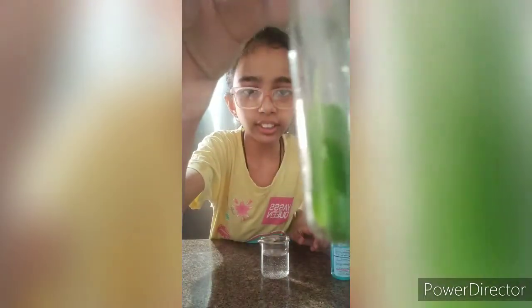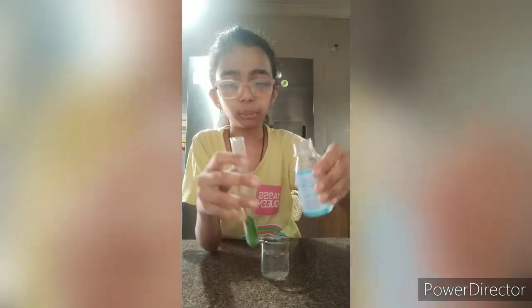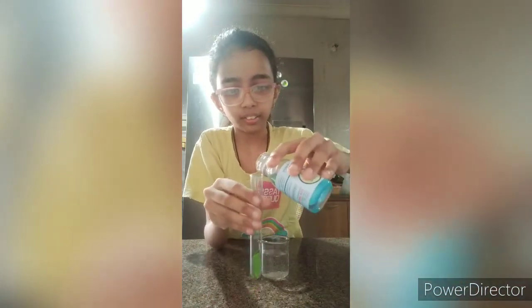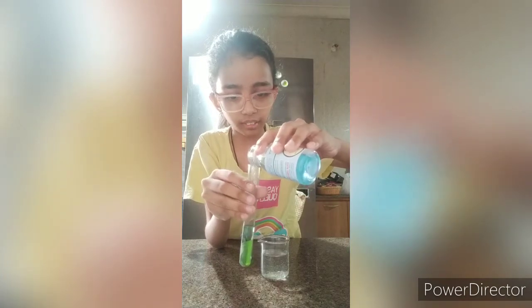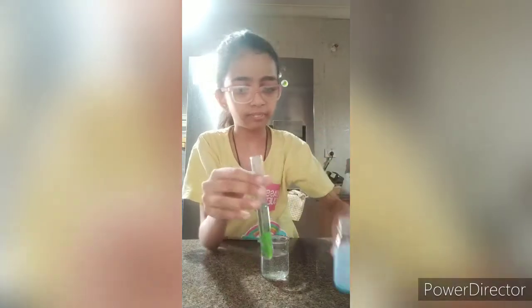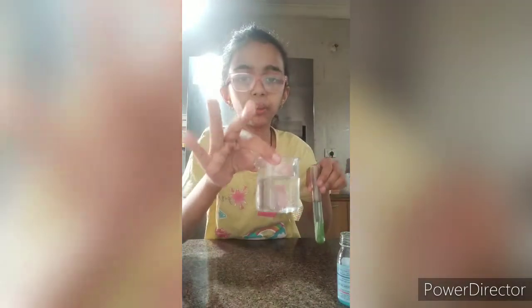Once I am done, if you can see, I have put the leaf in the test tube. Now, I am going to pour some spirit in the test tube till it covers the entire leaf. As we see, it has covered the entire leaf. Now, we will place this test tube in a beaker half filled with water.